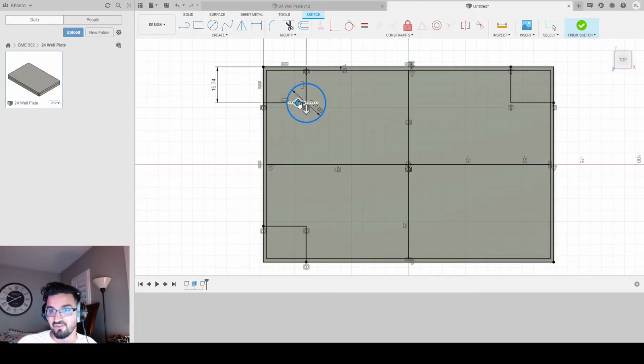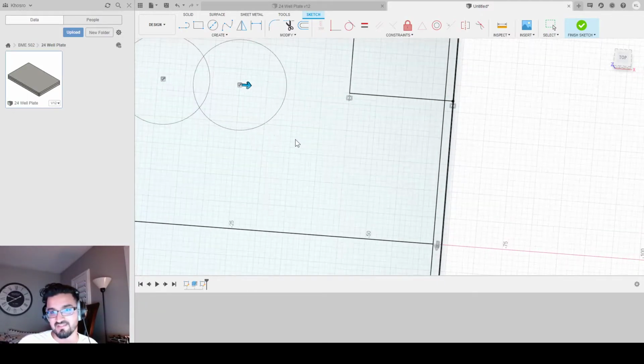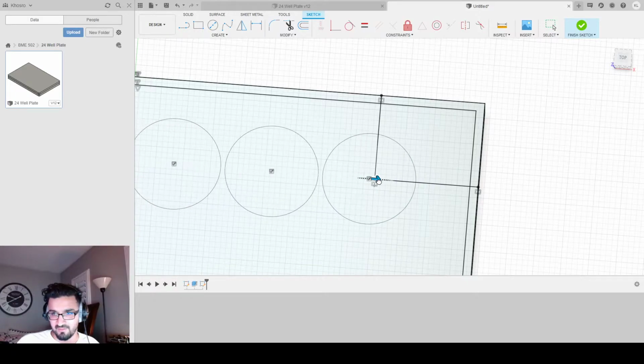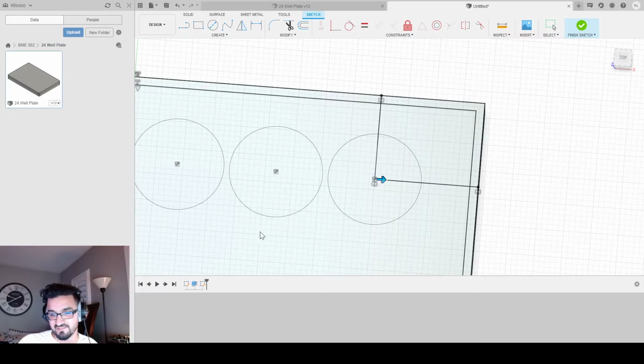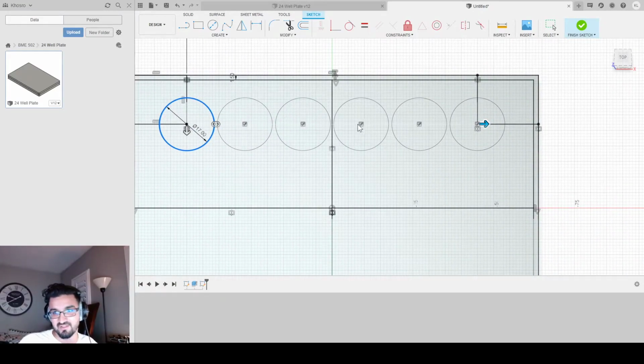If you just select the circle and choose a direction to replicate, it'll replicate for you, like whatever you need. So I'm going to replicate 6 of these circles in a pattern that's going straight across this way. And if you notice, the check mark is the center of the circle, right? So I want to place the check mark right at the corner here, so it's the correct distance across. Now, if I'm working on another project, just so you know, you can disable these circles. So if I click this, this circle will not be here anymore, but the rest will be, right? So you could choose to have gaps if you want, but we don't need to. We need 6 identical circles going straight across for this project.